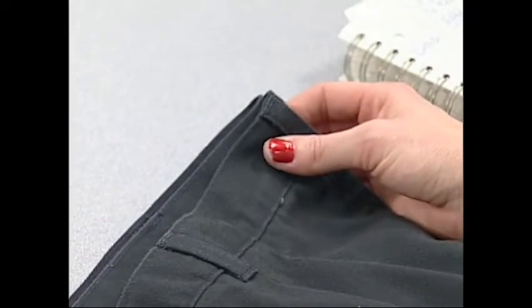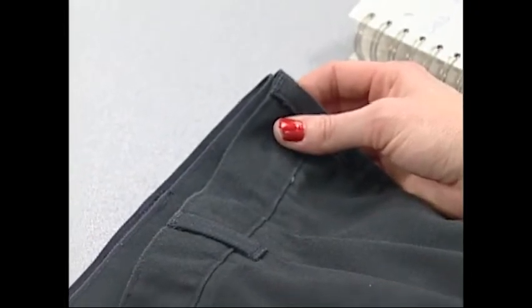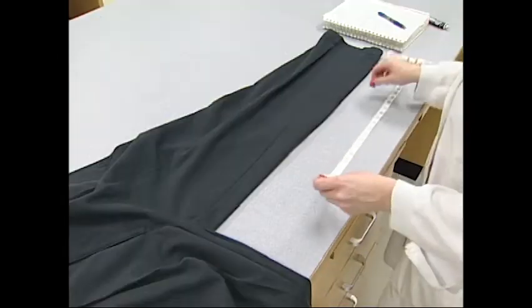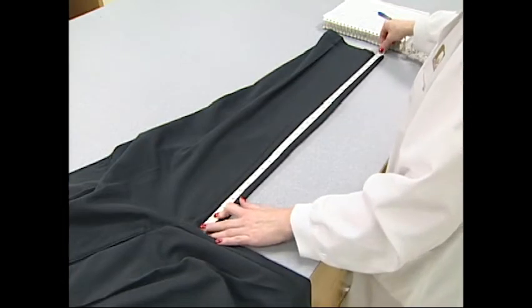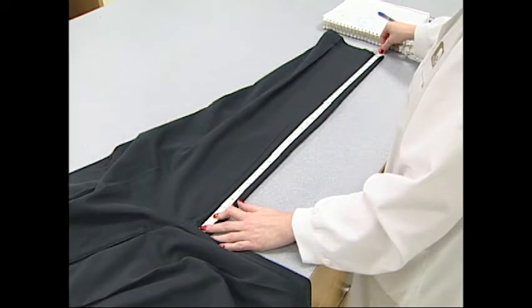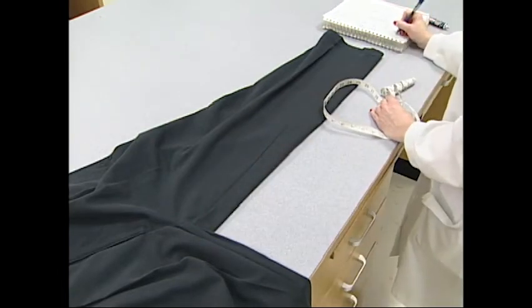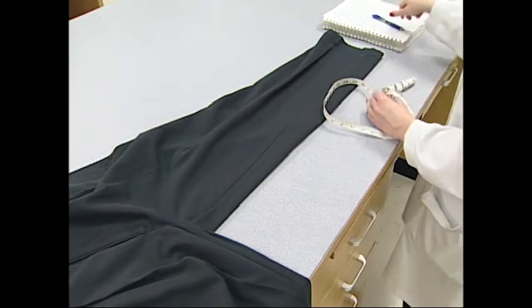Here, a pair of laundered pants is compared to a pair before laundering. The right edges of the pants are held even and the amount of shrinkage of the waist is clearly seen on the left side. After laundering, all the benchmarks are measured again and the shrinkage values are calculated with the same method as used with the shirts. The inseam is measured and the length is recorded, and from this data and the original inseam length, the length dimensional change is calculated.